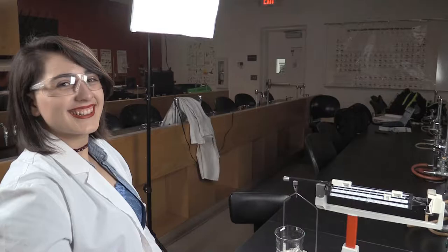Quad beam balance! Ileana is going to assist us with using the quad beam balance. She always has a smile on her face when she is doing science and engineering.